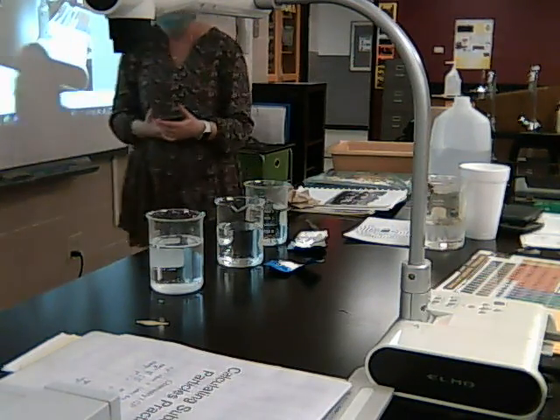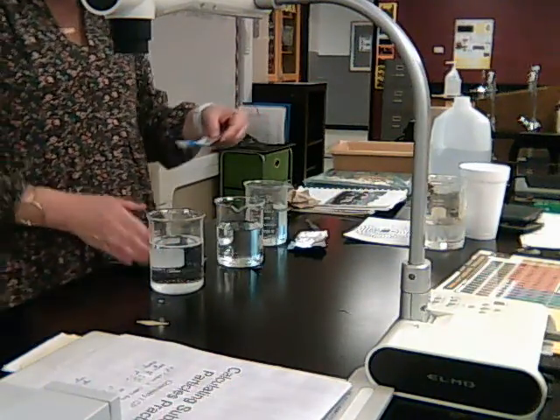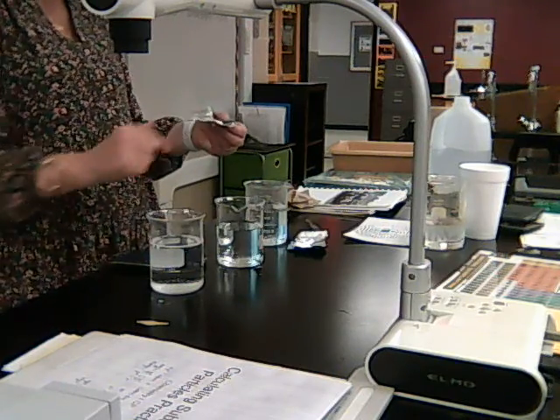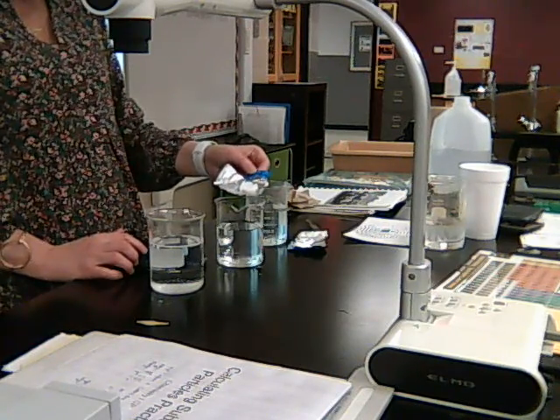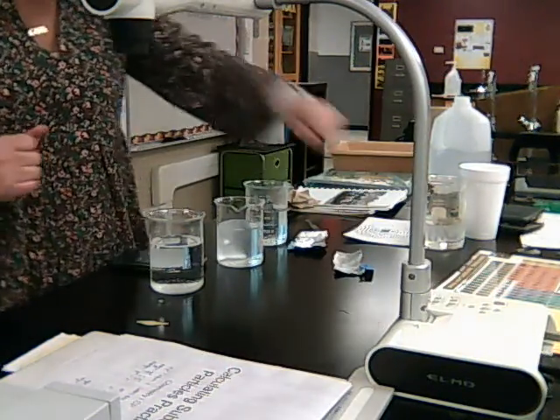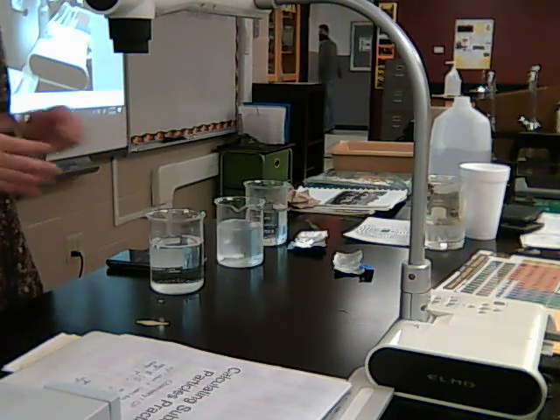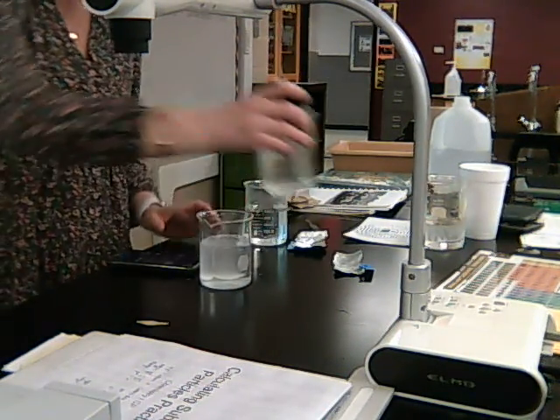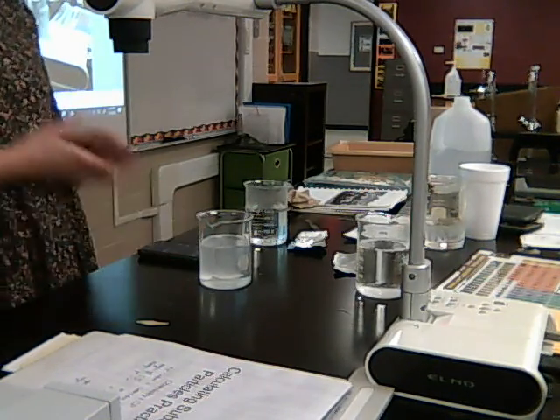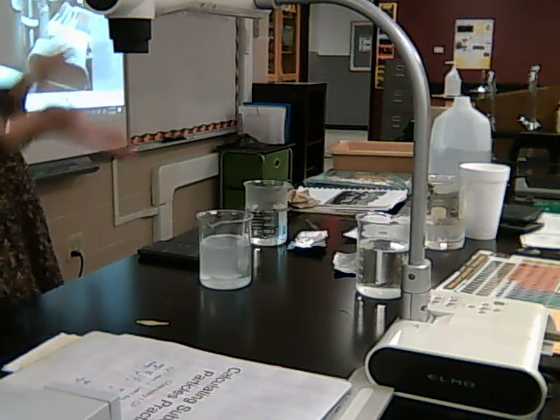Okay? So I'm going to reset. Now I'm going to do the halves. And I'm going to start once I drop it in, and I'm going to stop when it's gone again. This is the room temperature water, by the way. Make sure I got it all in there. That one looks like it's happening quicker, doesn't it? You can just look at the bubbles and tell they're coming up faster, right?